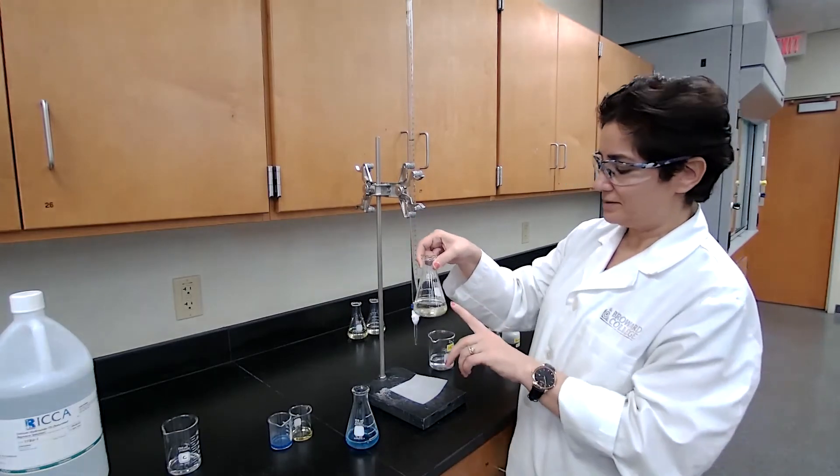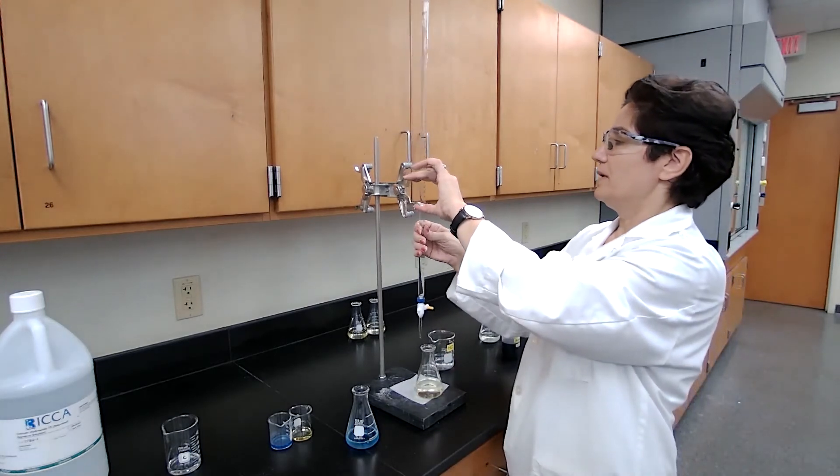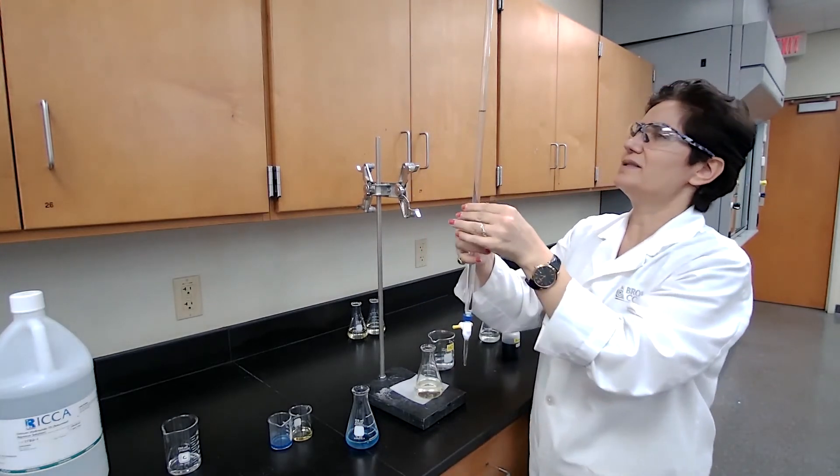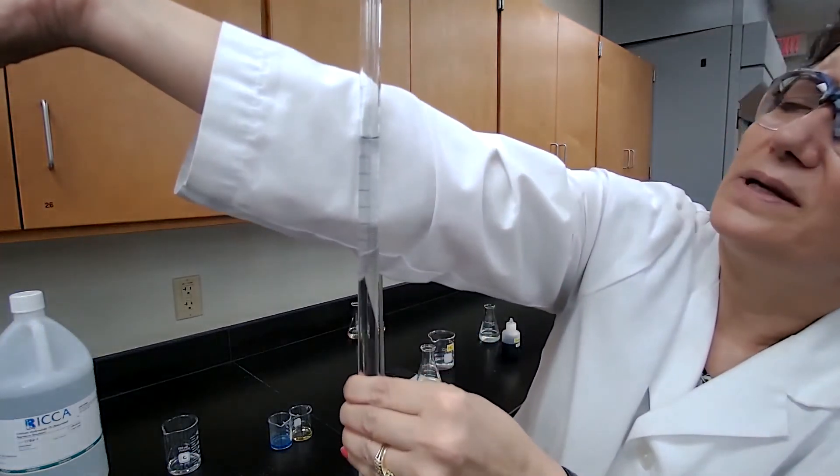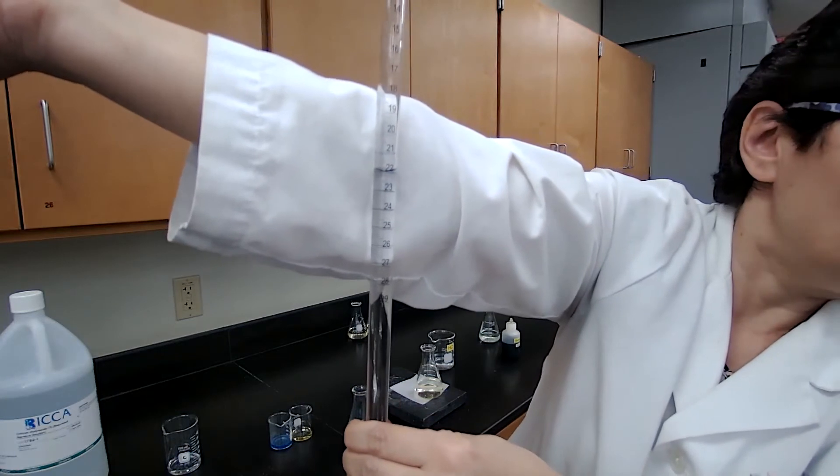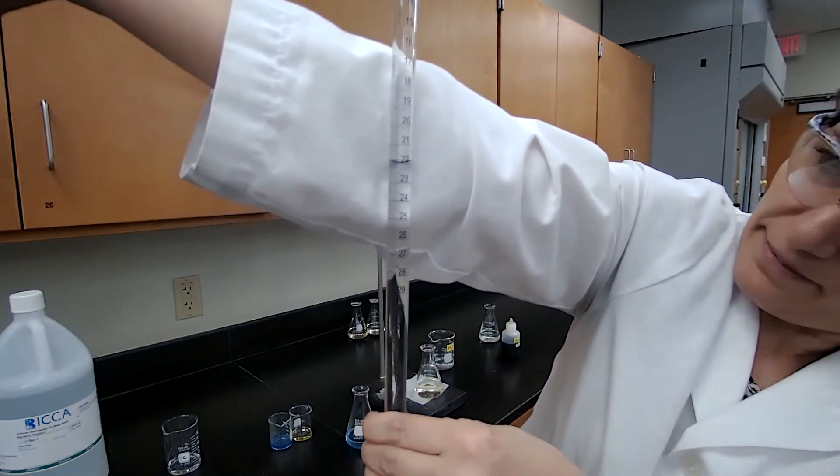End point of the reaction. Now we are going to record this number. Hopefully you can see it because it's exactly on the line. And for this one is at 22.00 based on my view.